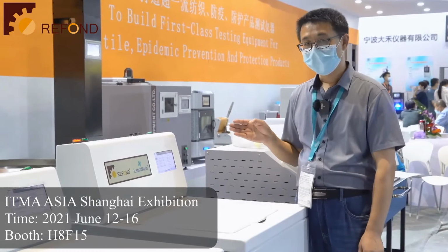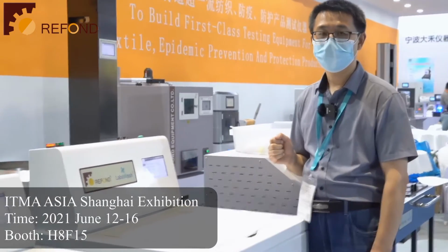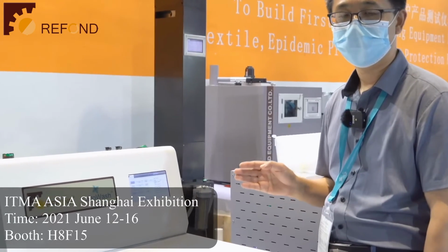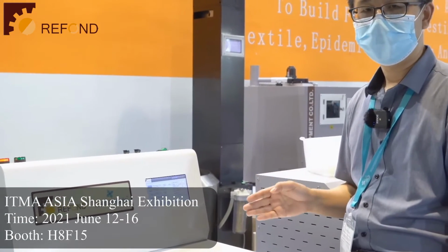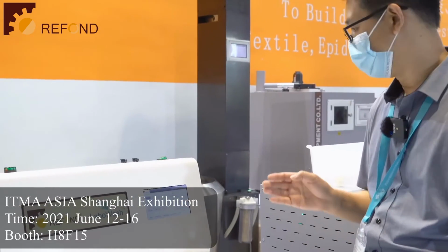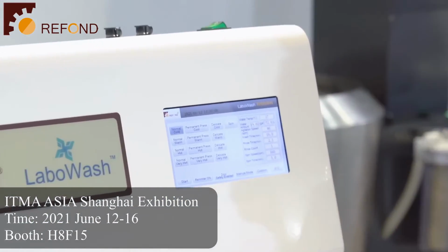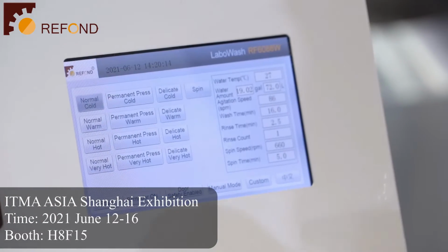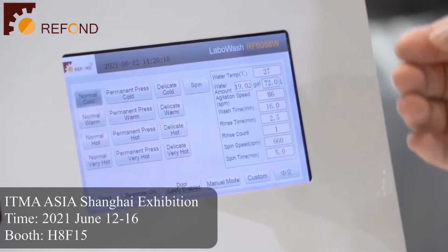Also, our LaboWash washing machine has the function to do cyclic washing programs. You can do 5 cycles, 10 cycles, or even 50 cycles. The washing programs for different fabrics. Let me introduce the functions of our machine.